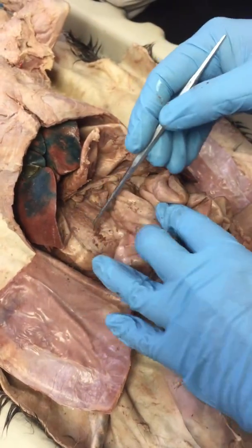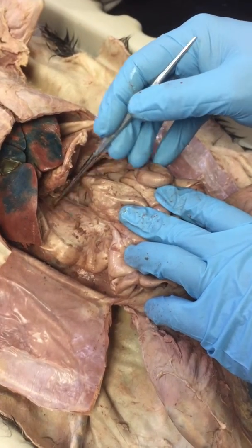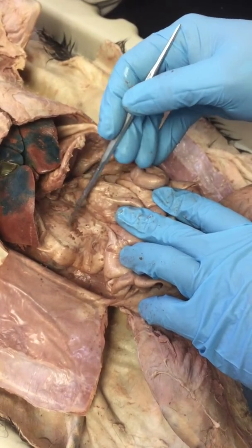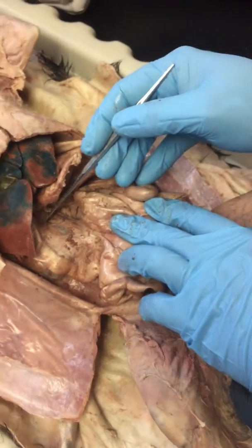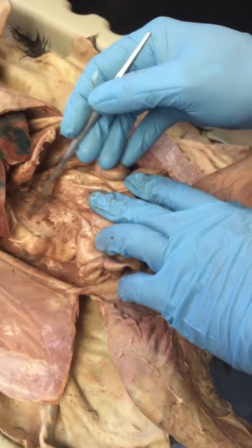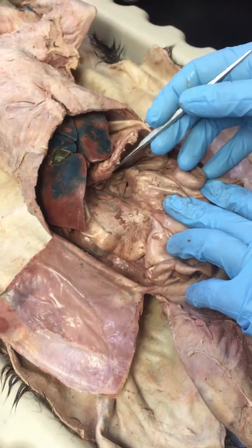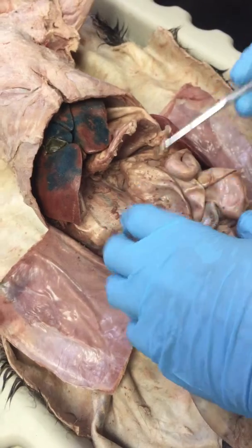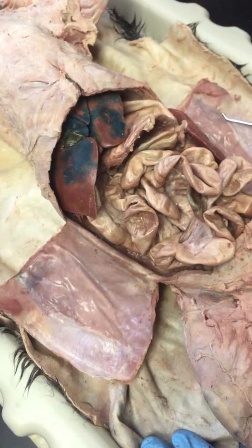Cats have another lobe of the pancreas right here along the duodenum. So what would that be called? The duodenal lobe. Yeah. See how easy this is? The part of the pancreas that's right along the duodenum is called the duodenal lobe. And that's right here. No tricks. That's right there.